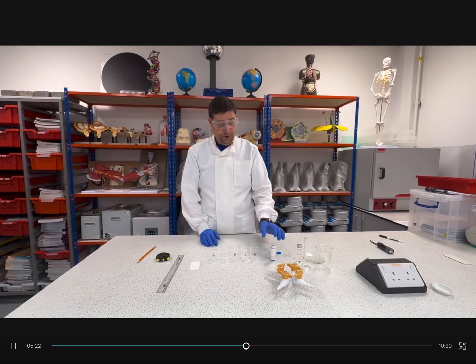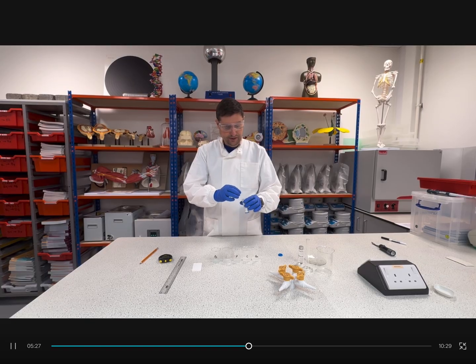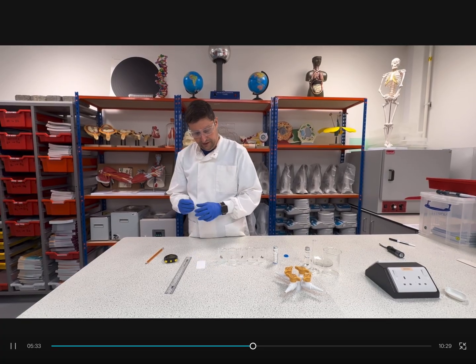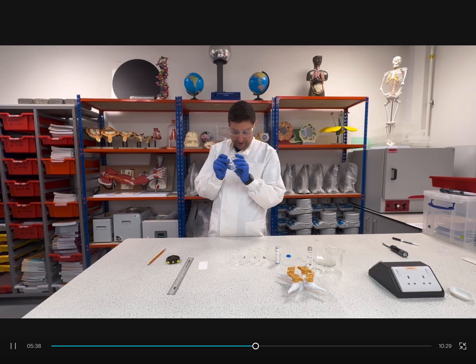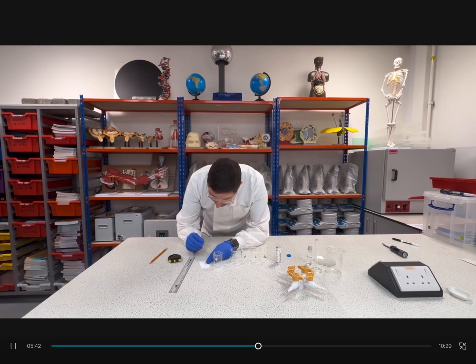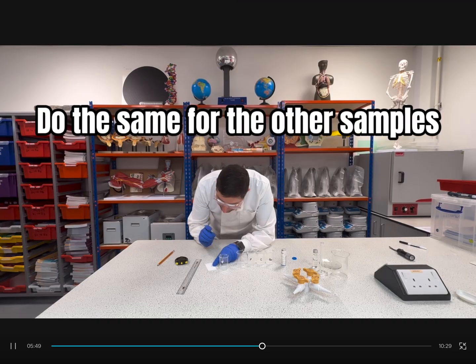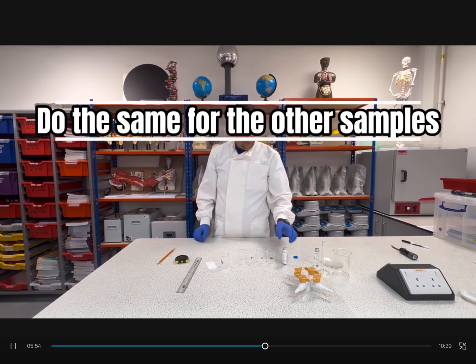So now, using the capillary, I will transfer the first sample. So the first sample will be aspirin. So let me rotate from facing myself. I will try to collect a little bit and dispose, giving some knocks on the right position.